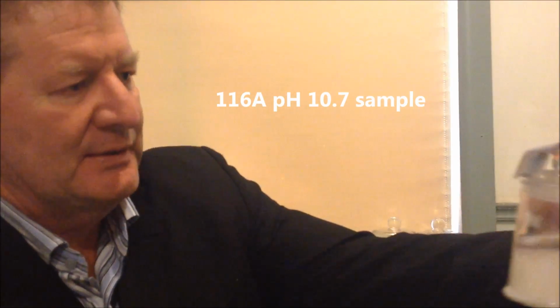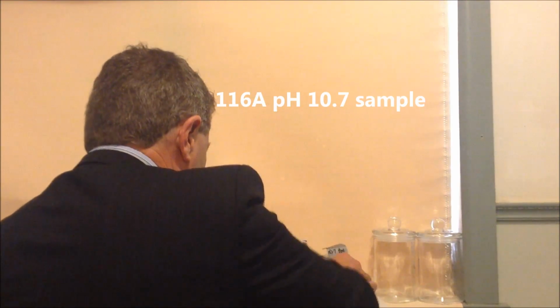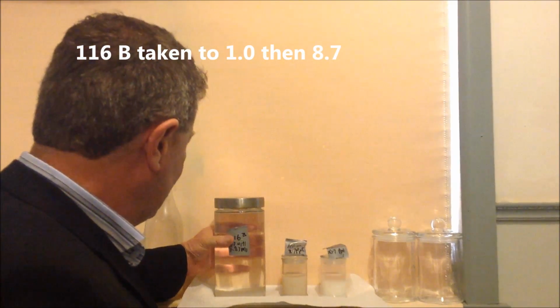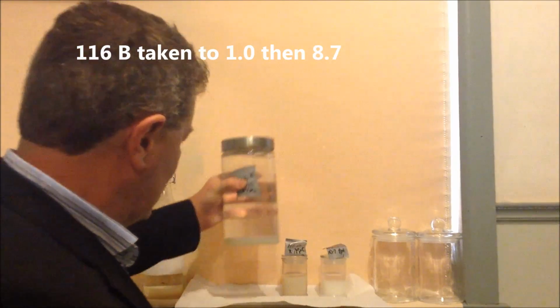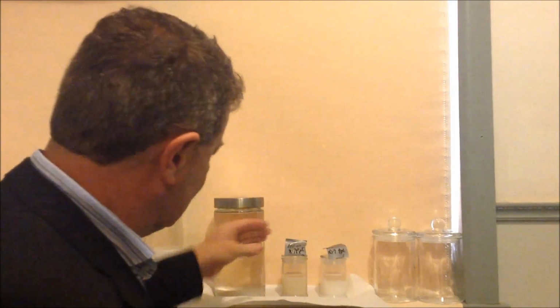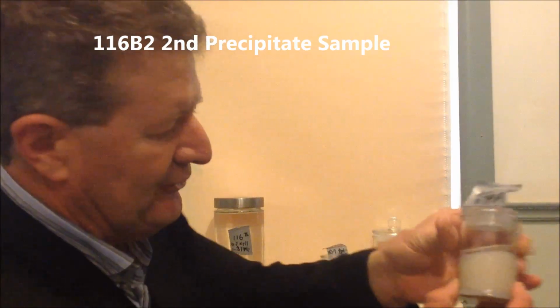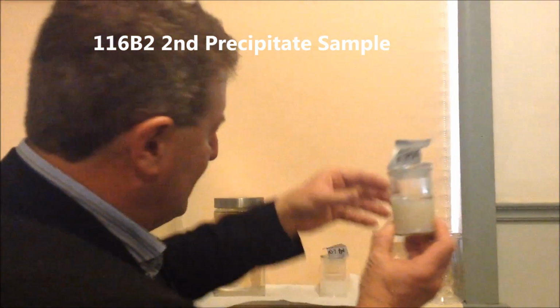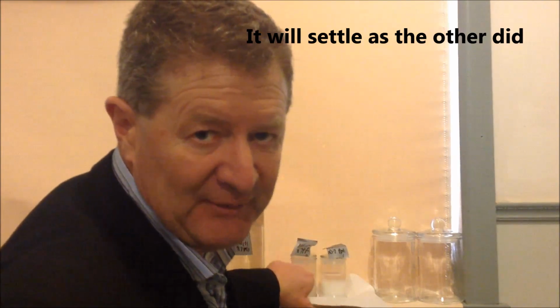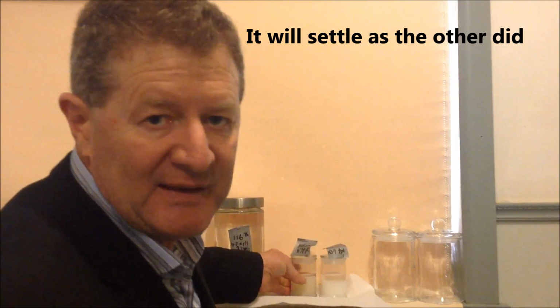As you remember, I took a sample out at pH 10.7 and then took the rest of it back down to pH 1 and then back up to 8.7 to first of all dissolve it and then to re-precipitate, which has been done, and you can possibly see that there. Now I've taken a sample out of that so that we've got roughly equal samples, and it does look a little bit more in that one, but the level's the same and it's taken at a similar stage in the precipitation, so I believe there's about the same amount of precipitate in each one, but I think that's going to be immaterial to the experiment in any case.